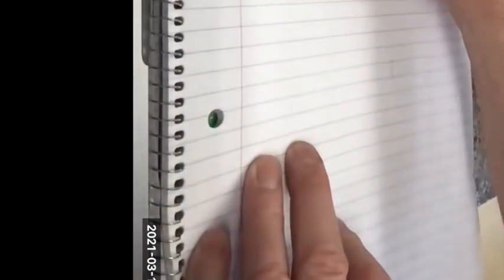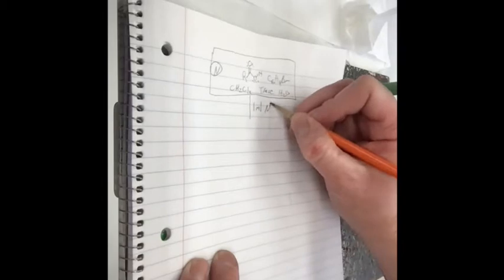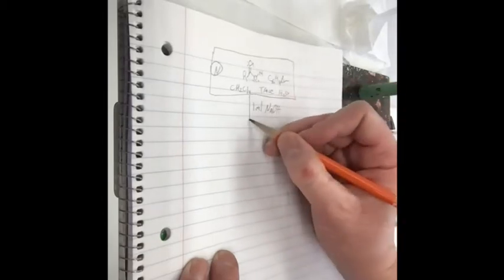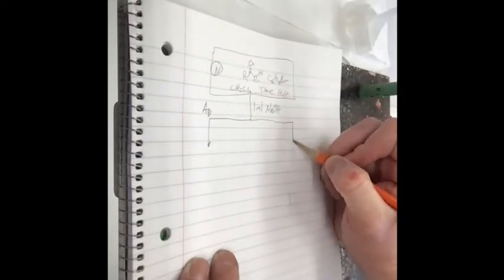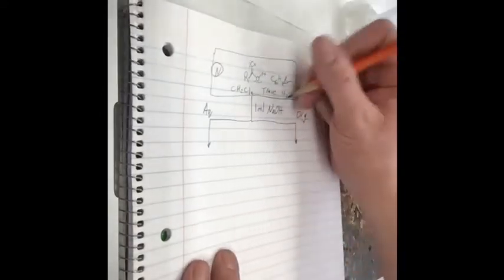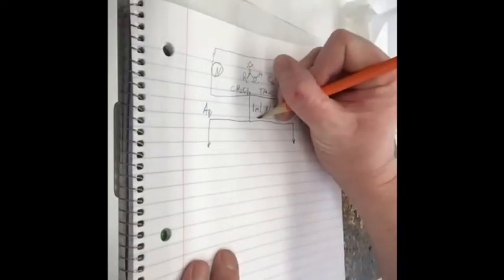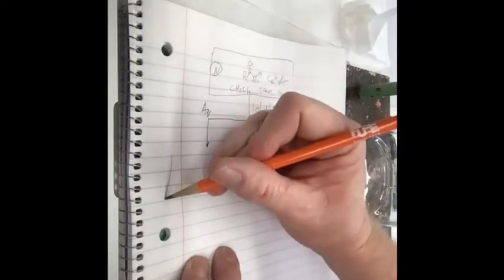So what do we want to do at this point then? Is this where you add 1 molar sodium hydroxide and then you'll add 6 molar hydrochloric acid to see if you have the acid in the solution? Got it. Good job. So I feel like I have an acid in here, right? And I'm going to add about 20 milliliters of that.